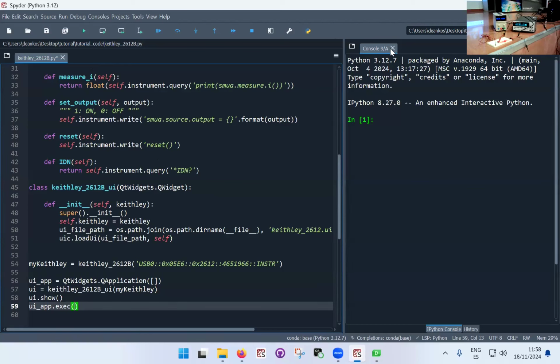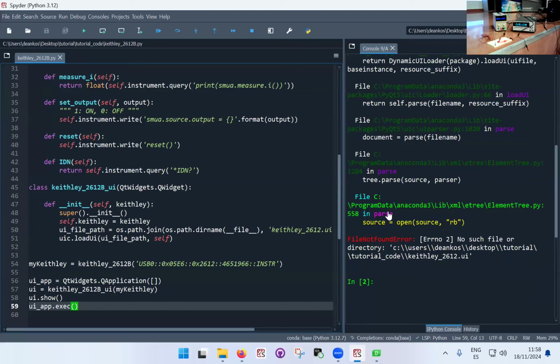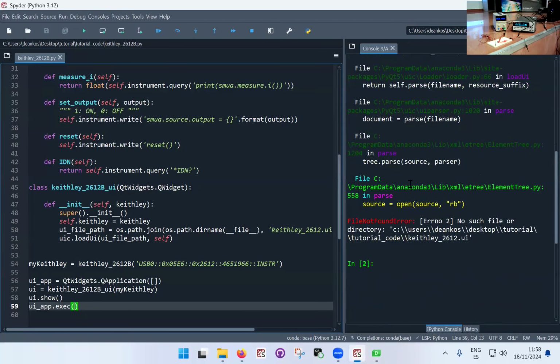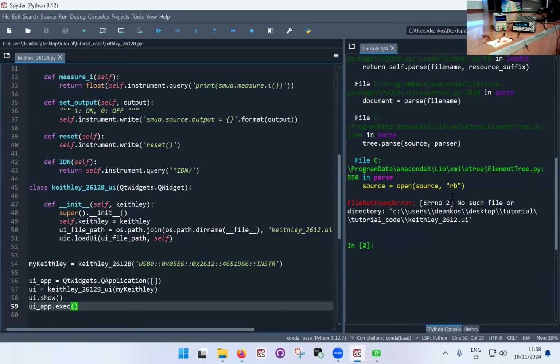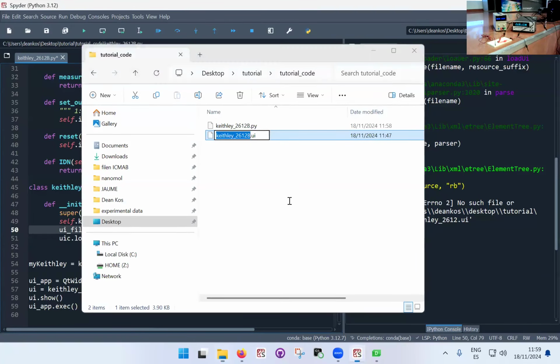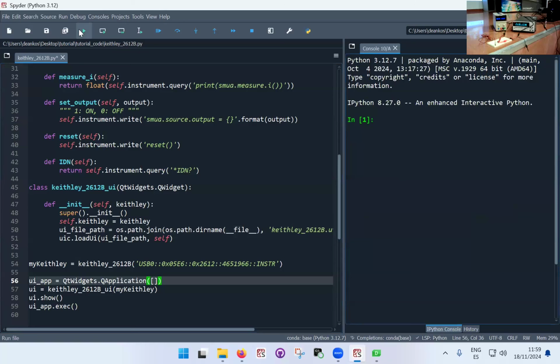So in principle, now as I run this, a window should pop up. Okay, so I'm gonna run it. Let's see, unless there's any errors. Yes, there's an error. That's what happens when you do things in real time. I think it's a file not found error, clearly, so there must be an issue with the name of the file. The proper way to do it will probably be to copy paste the name of the file from here, so you make sure that you're not making any errors. So I'm just gonna rerun it.